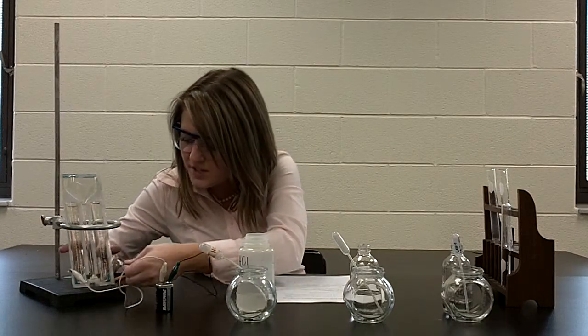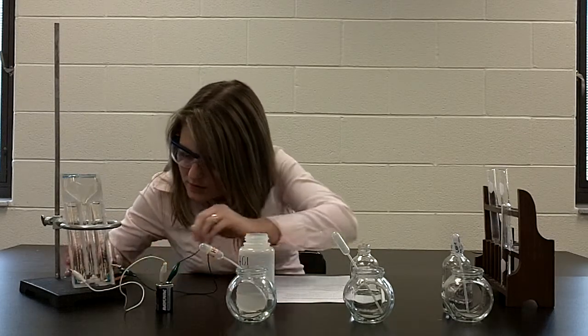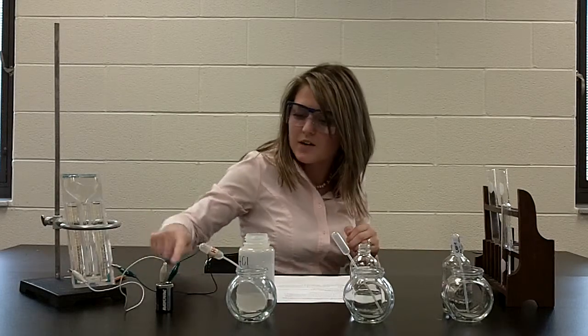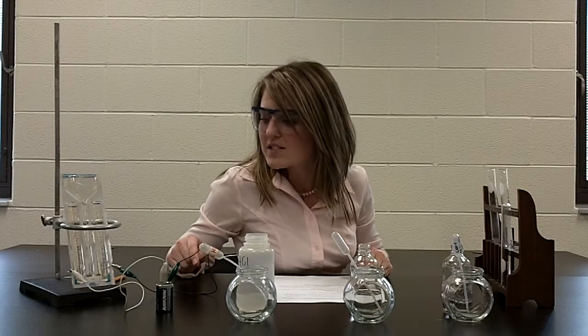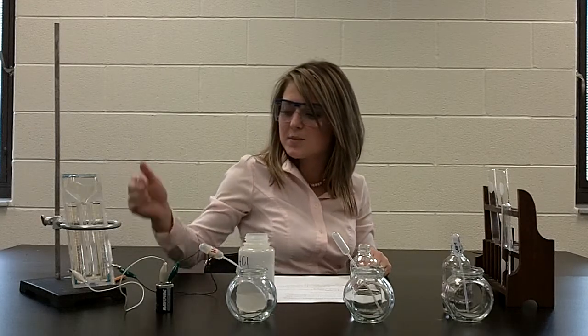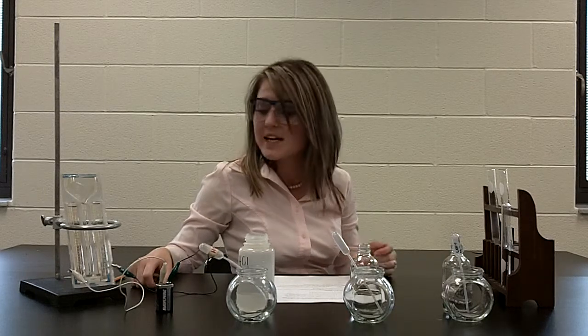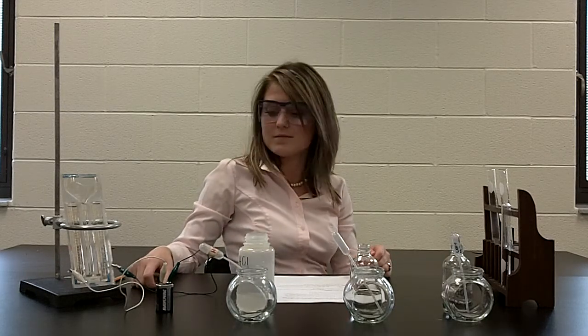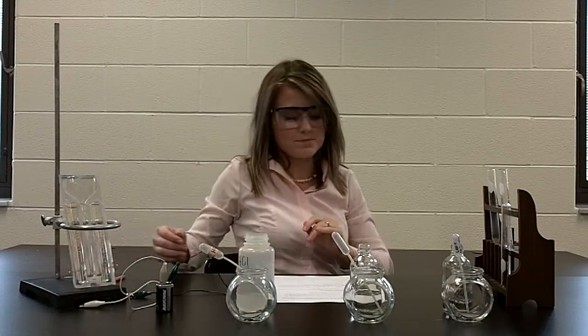When you add voltage or add electricity to this, you start seeing, especially on the negative side of the battery, bubbles forming. And what's happening here is the saline solution is being split into gases, hydrogen and oxygen. Again, the bubble formation shows that gas is being formed from this reaction. When you're done observing this part, you can unhook the battery, and we'll move on to step 2.